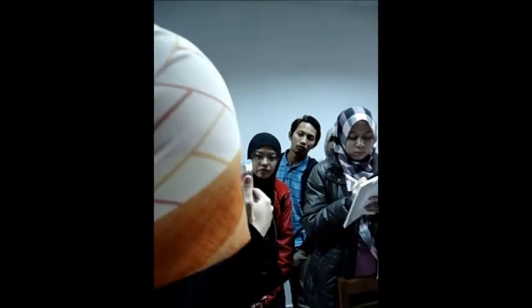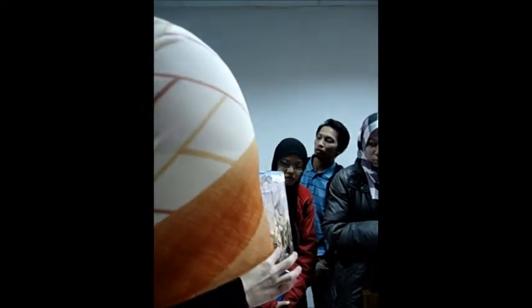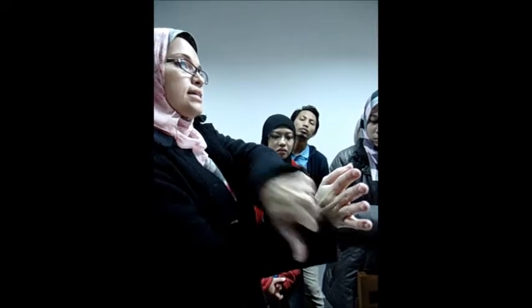We say the size. Is it a small size or a large size? So single ulcer, it is large size. We describe the edges. The edges of the ulcer are the ends of this ulcer. The very end of this specimen. Do you see this? The very end of the lesion. That's the edge. Okay? Edges could either be everted, so they are protruding outwards. And how do I know it's everted? If I bring a probe and try to fix it beneath this part, it will go in. Okay? So that's an everted edge.